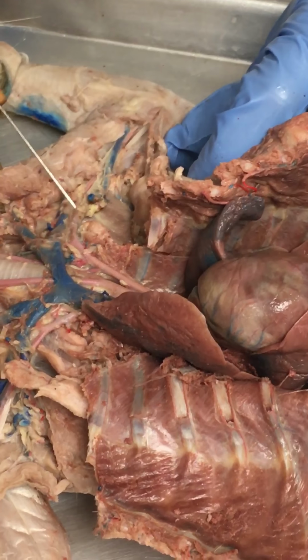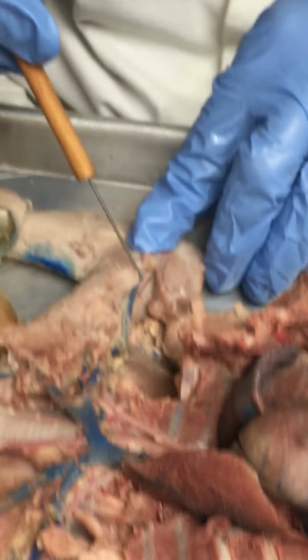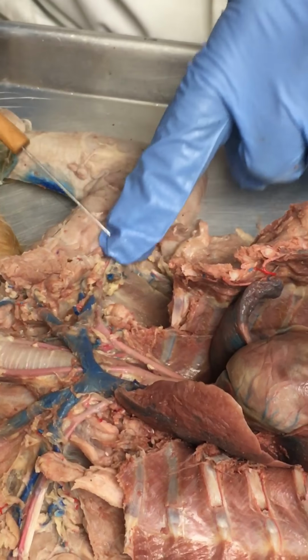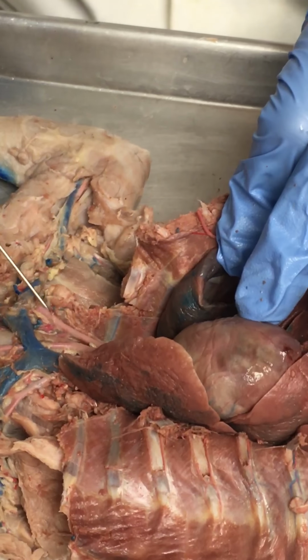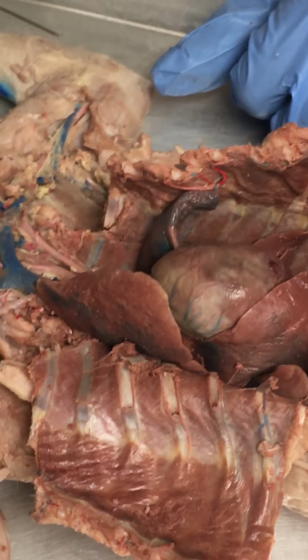Once we get that blood vessel, say right about here, you can see it there, that's in approximately the armpit region, so I'd pin it there for the axillary. Then we can see it again all the way out here, and there it is again, and it would be brachial. So same blood vessel, this time going all the way back to the heart itself, just named differently based on different regions. All right, I think that's it, on the kitty cat at least.